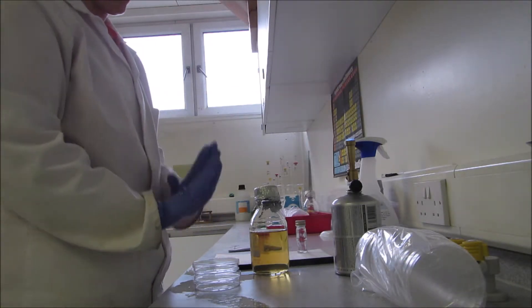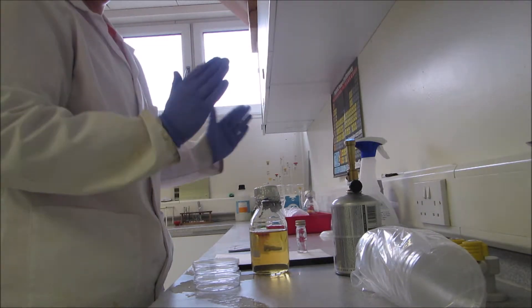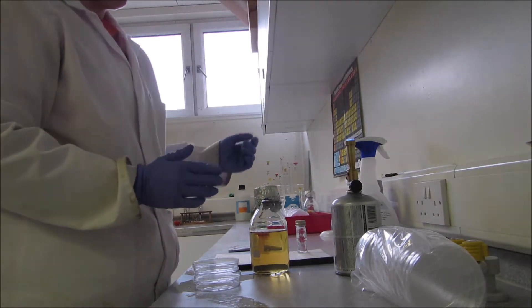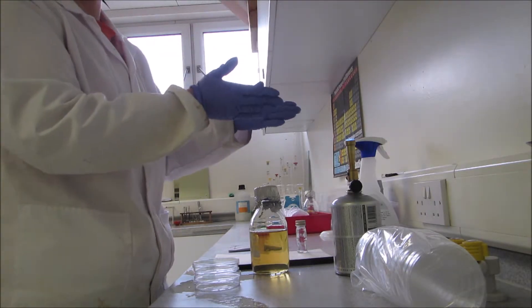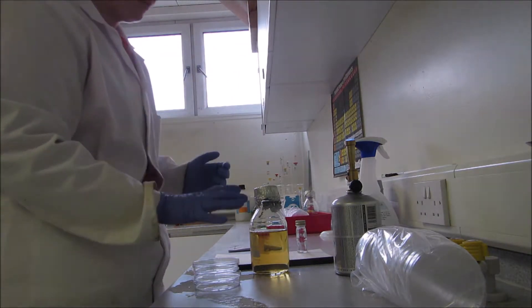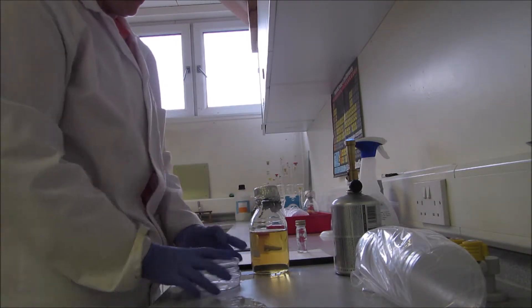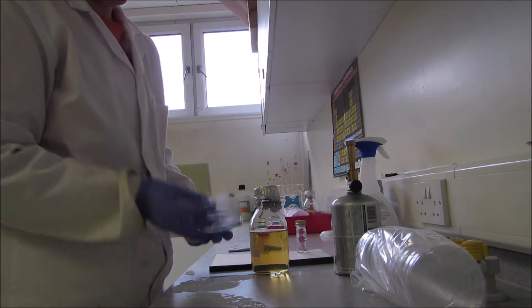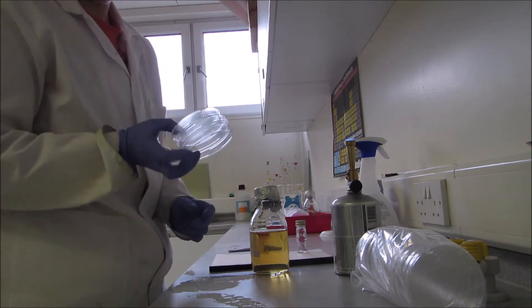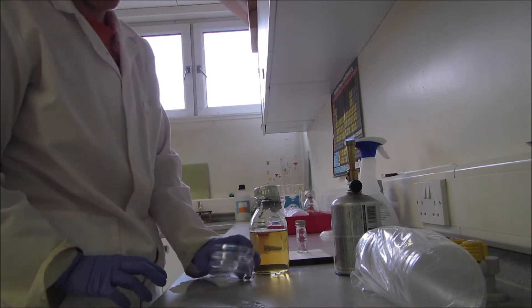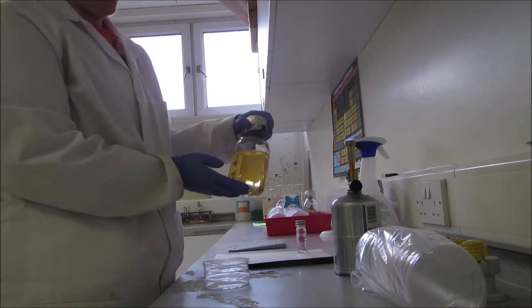I want to work as close as I can to the flame where it's safe to do so. I can feel the heat of my Bunsen burner back here, so I know I'm within the aseptic zone where any bacteria in the air is being sucked into the flame and killed. Take a petri dish—I take them in stacks of three because I can hold that well with my hands.